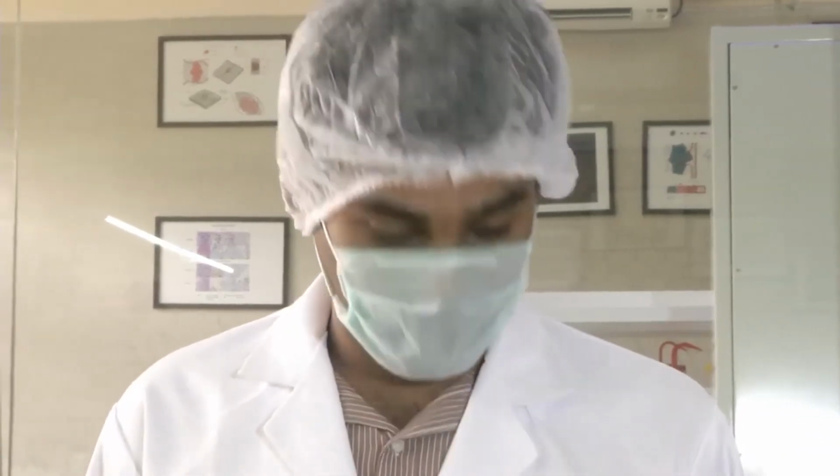The HEPA filter is a very core part of maintaining a clean room environment. Then you might think, the HEPA filter will take care of the particulate matter, so why are we so concerned about the gowning procedure and cleanliness aspects? That is because every device has its limitations. The HEPA filter has a series of filters.